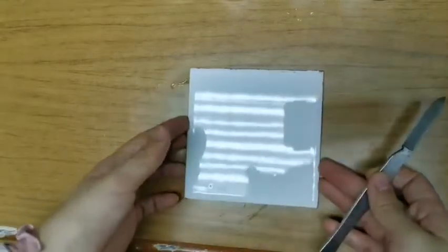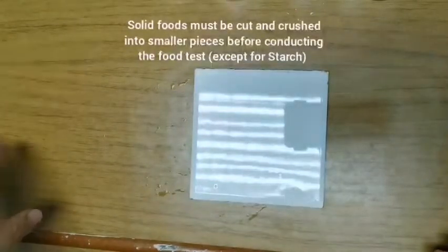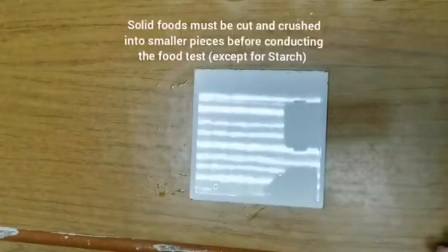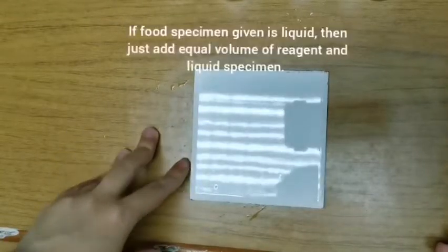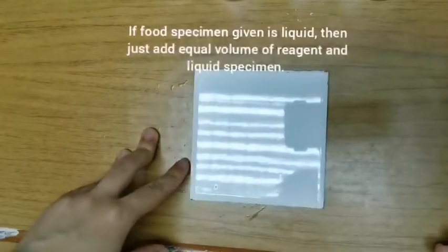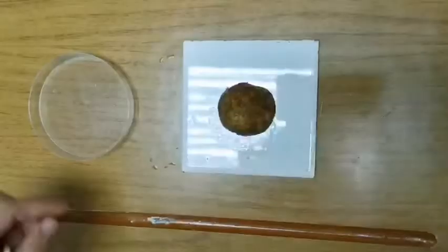If the food specimen given to you is solid food, then the food material has to be cut up into very small pieces. How small? As small as possible. We'll say toothpaste consistency. If the food specimen given to you is liquid, then it's very easy. You just need to add an equal volume of the reagent.